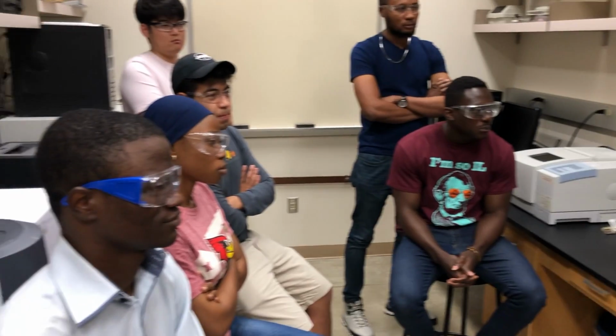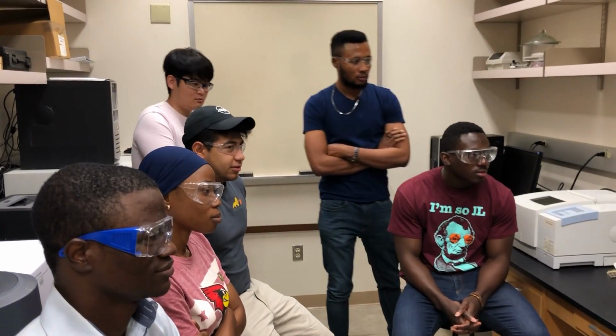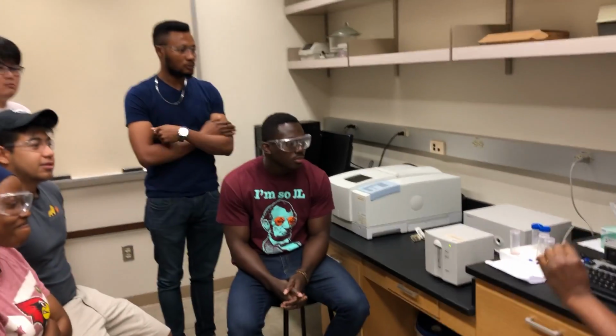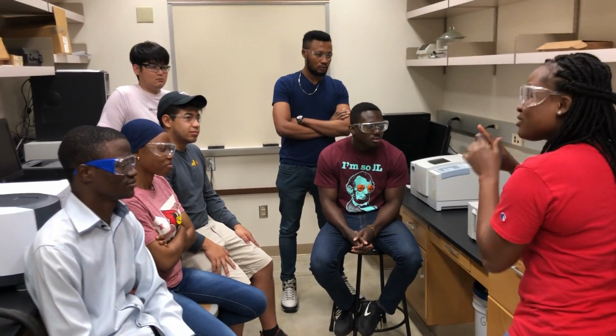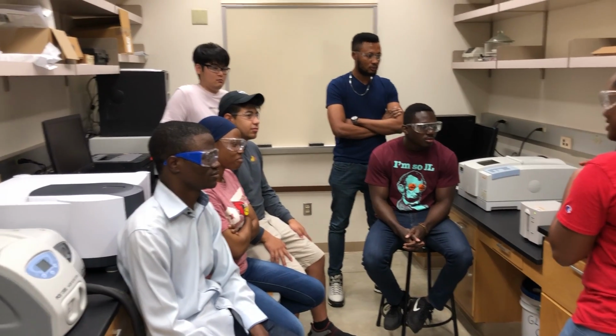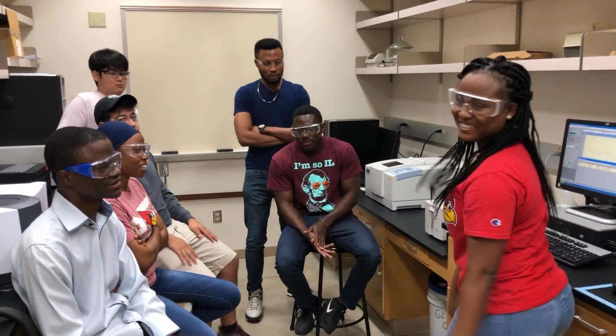Any other question? Okay, so you can all now move to your bench, and start this lab safely. Don't forget to wipe the cuvette. Don't forget to dilute. Don't forget to change the tips of your pipettes, and then you're all done. If you have any other question, just let me know. Awesome.